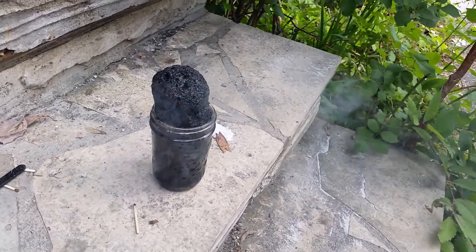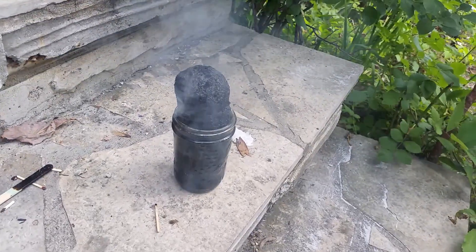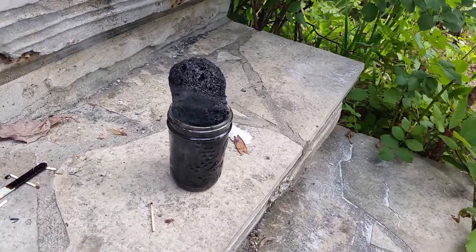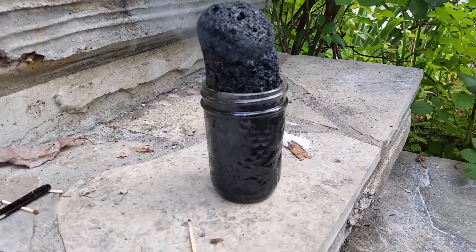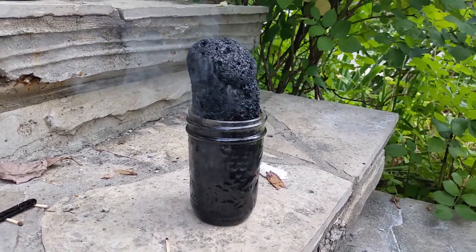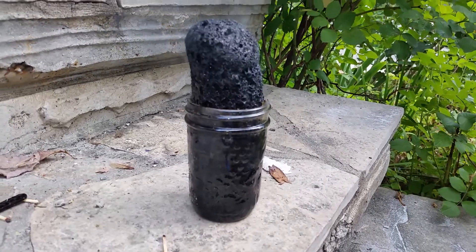They sped up the video — that's pretty crazy. It stinks. What do you think? It smells like burnt sugar and sulfur. Nasty stuff. And when that all cools down, that should be safe to touch. Just a pillar of carbon.